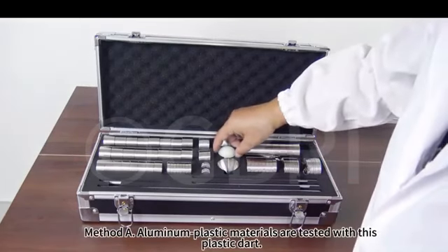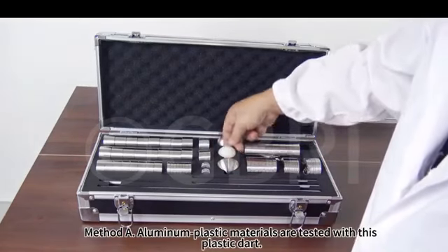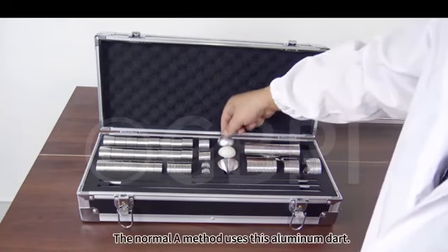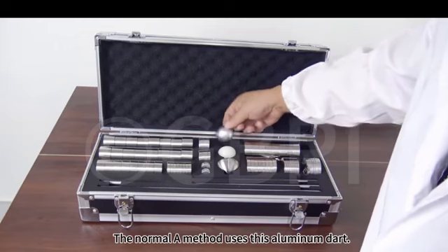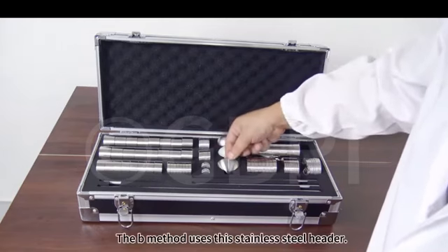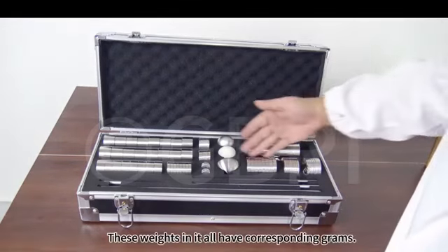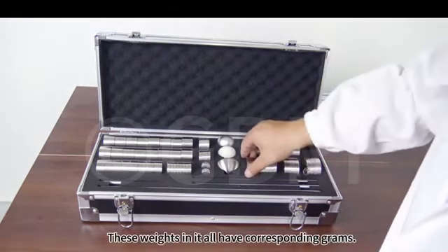Method A, aluminum plastic materials are tested with this plastic dart. The normal method uses this aluminum dart. The B method uses this stainless steel head. These weights in it all have corresponding grams.